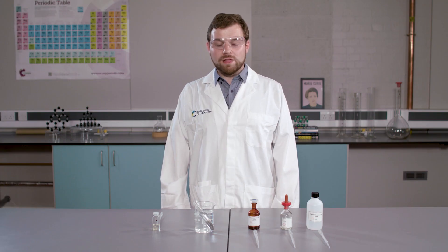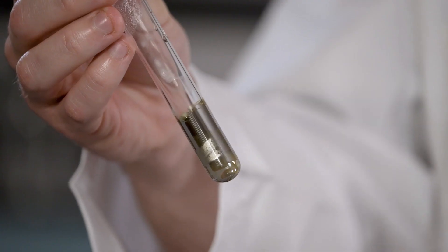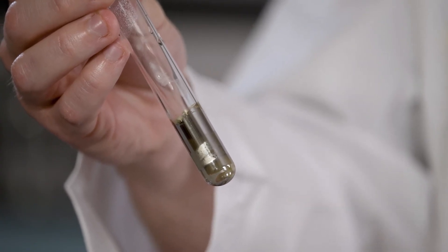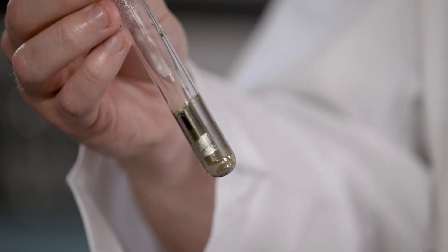It has now been 15 minutes. As you can see, a silver mirror has formed on the inside of the test tube, where a reaction has taken place. Don't forget to dispose of your reaction mixture immediately down a foul water drain.